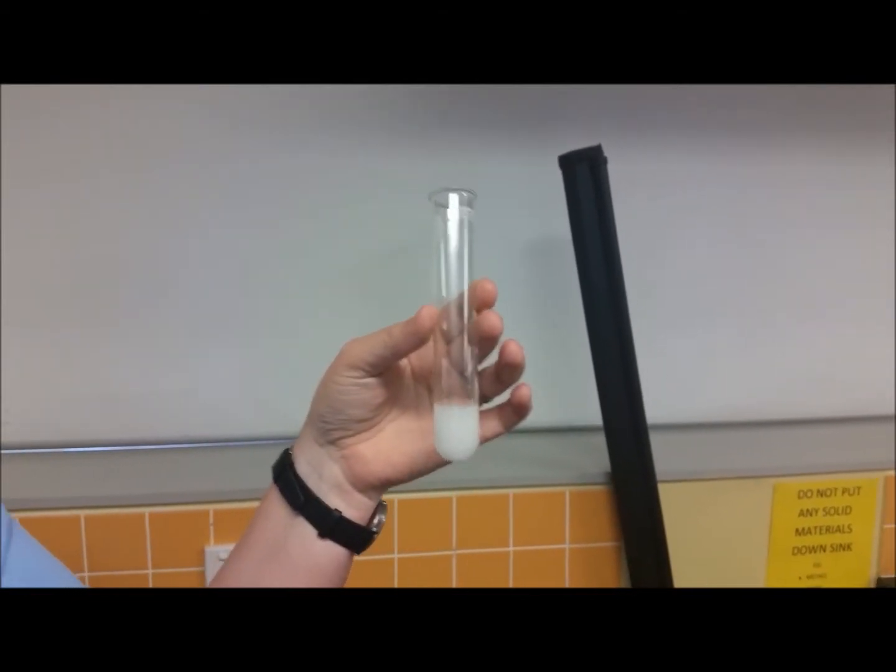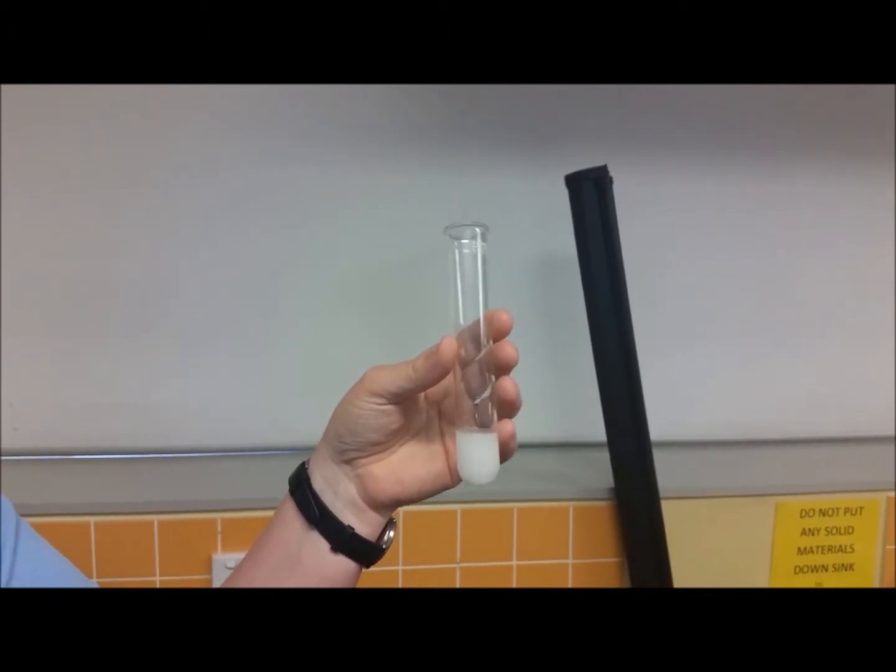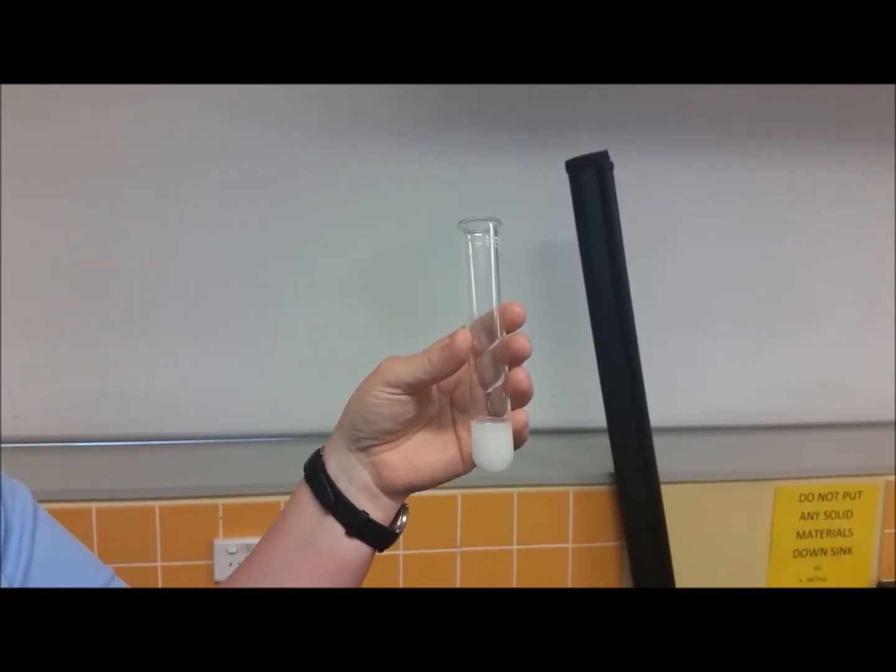We are going to do the third of our food tests today and we are going to look at the test for starch, yet another nutrient that we find in different foods.